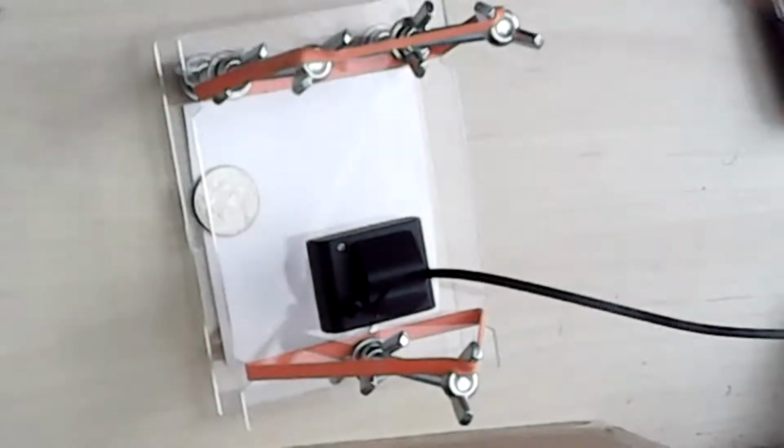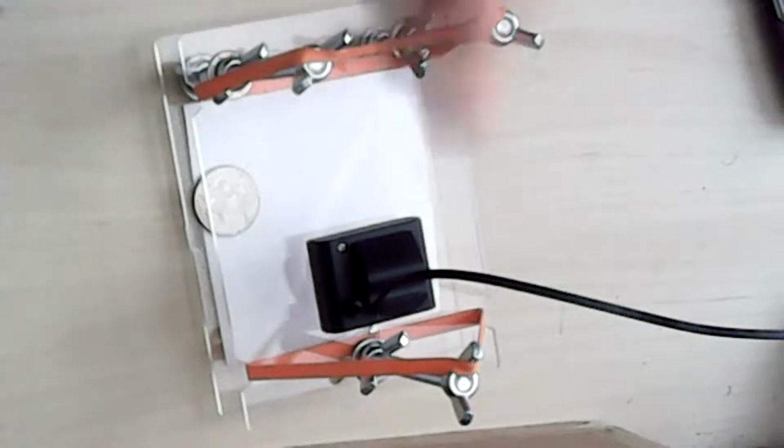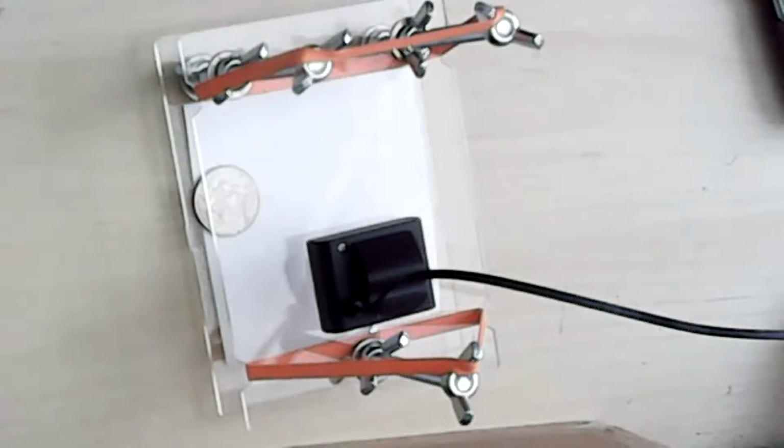So when you undo your webcam, you'll need to twist it a little bit to focus such that you're like 1 centimeter away from your target item. So you can kind of see it relatively clearly. Gotcha. Thank you. You can also use something like a ruler, or like Vanya has a coin or a dollar bill, to help make sure you've got the focus well too.